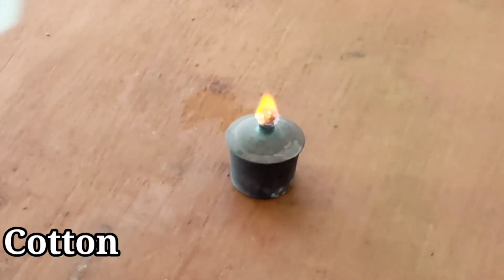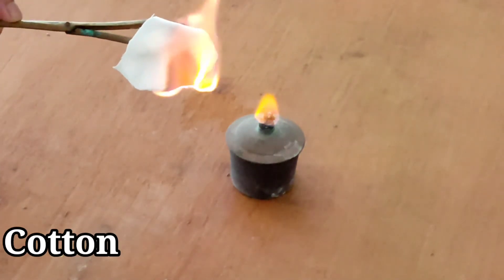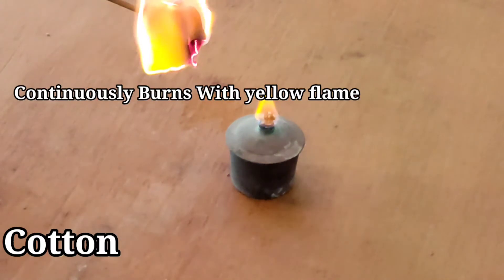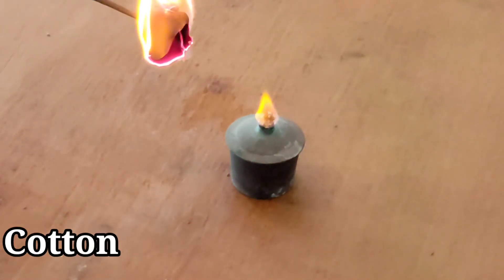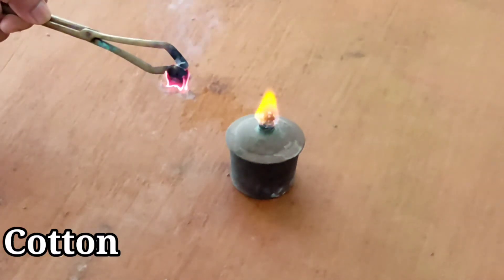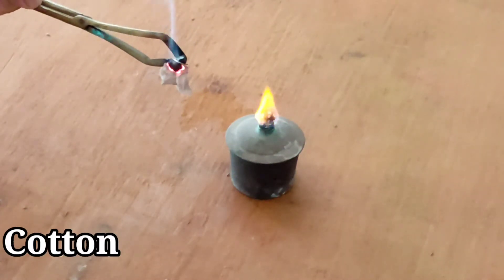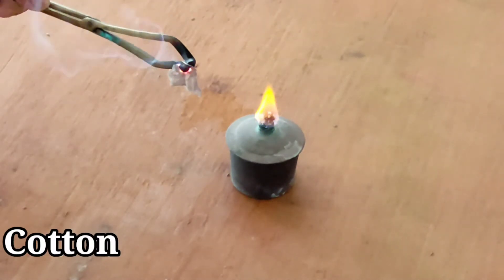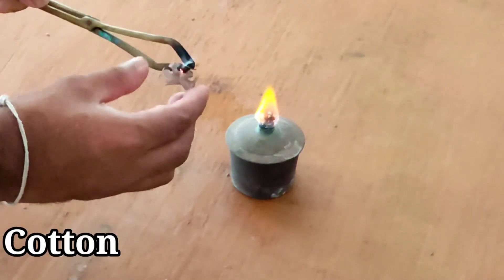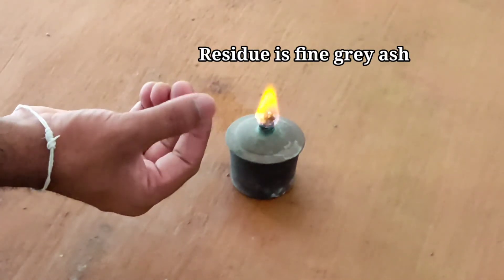The cotton fiber, when in contact with the flame, continuously burns after being removed from the flame. We observe a yellow flame and gray smoke. It smells like paper or wood burning.